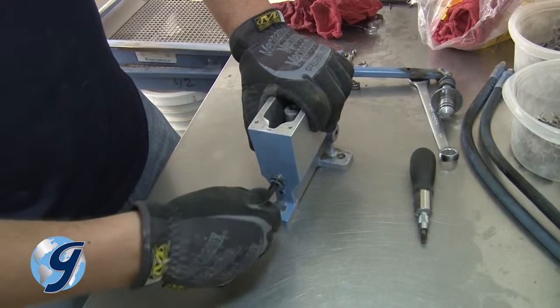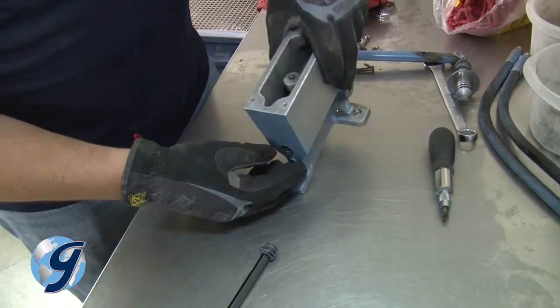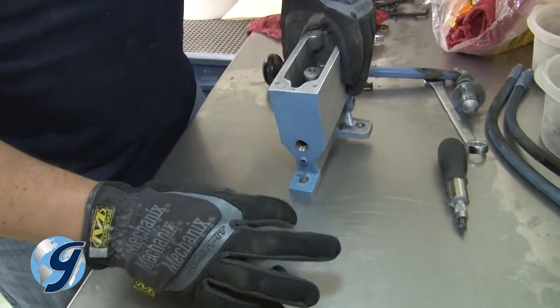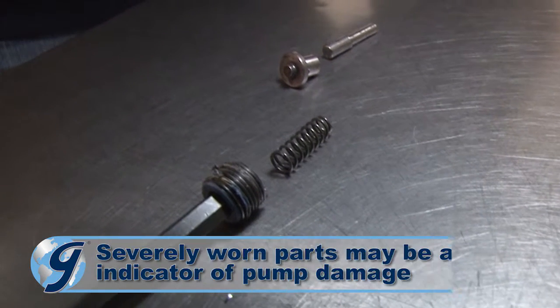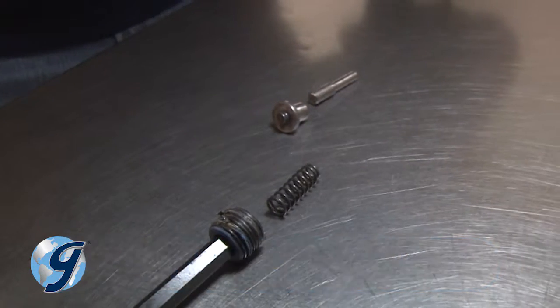Now, remove the pressure release plug, which is the largest plug on the pump. The pressure release spring and thrust pin with O-ring should come out easily when the pump is tilted. Inspect these items for wear and set them aside. Severely worn parts may signal further damage to the pump itself.